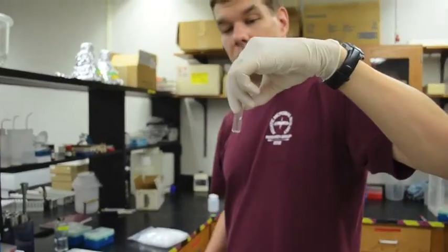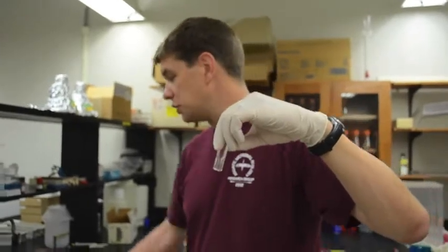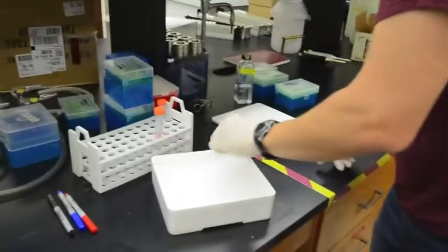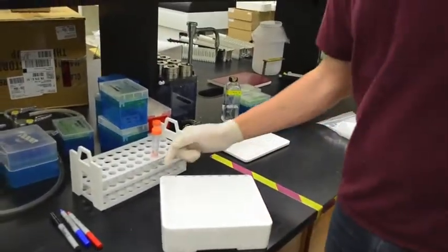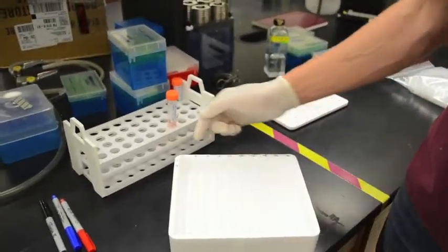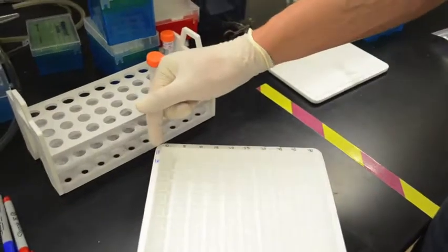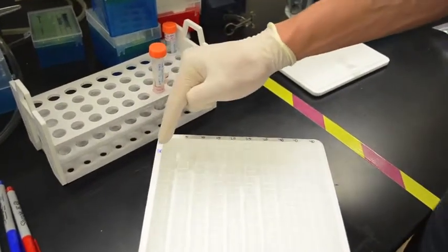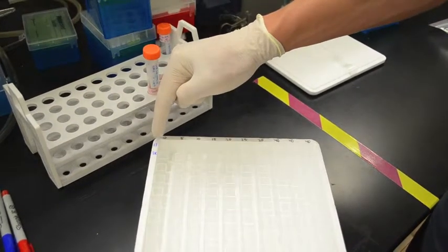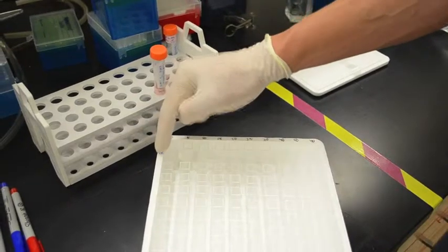So we're going to add first 1 milliliter of our sample to each of 20 of these cuvettes. So like I said, we want to do this measurement at different concentrations of substrates. And you can see that this is the rack that the cuvettes come in from the factory. And you can see that I've labeled this. On the rows, I've labeled 1L and 1K. It's a little hard to read because it's a small piece of styrofoam. But that's for substrate number 1 live and substrate number 1 killed.